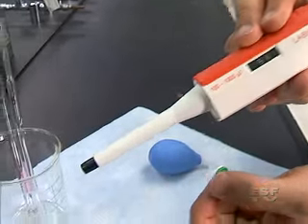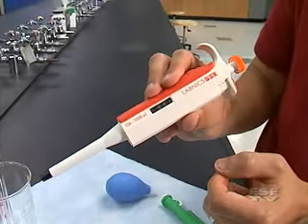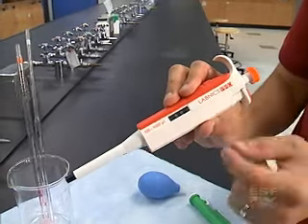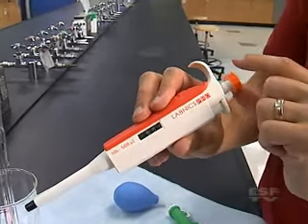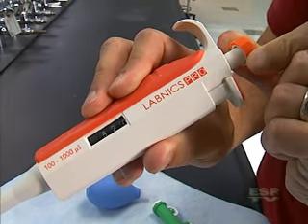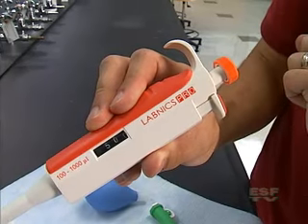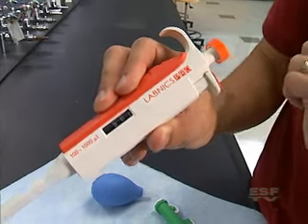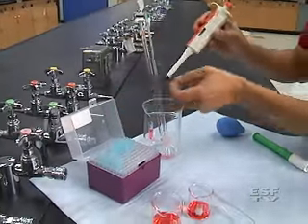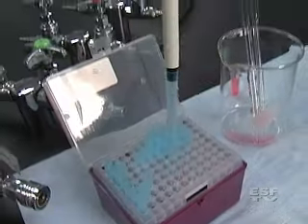Then we have the tip, where we put on disposable tips to keep everything clean and sterile. To change the volume all we have to do is rotate the top knob — you can see we can rotate up to 520, 515, 510, or 500 microliters. In this case we want 500. We're going to take a disposable tip — you'll find them in boxes such as these — and all we have to do is push down onto the tip and withdraw. Now we have a brand new clean tip for withdrawing our solution.